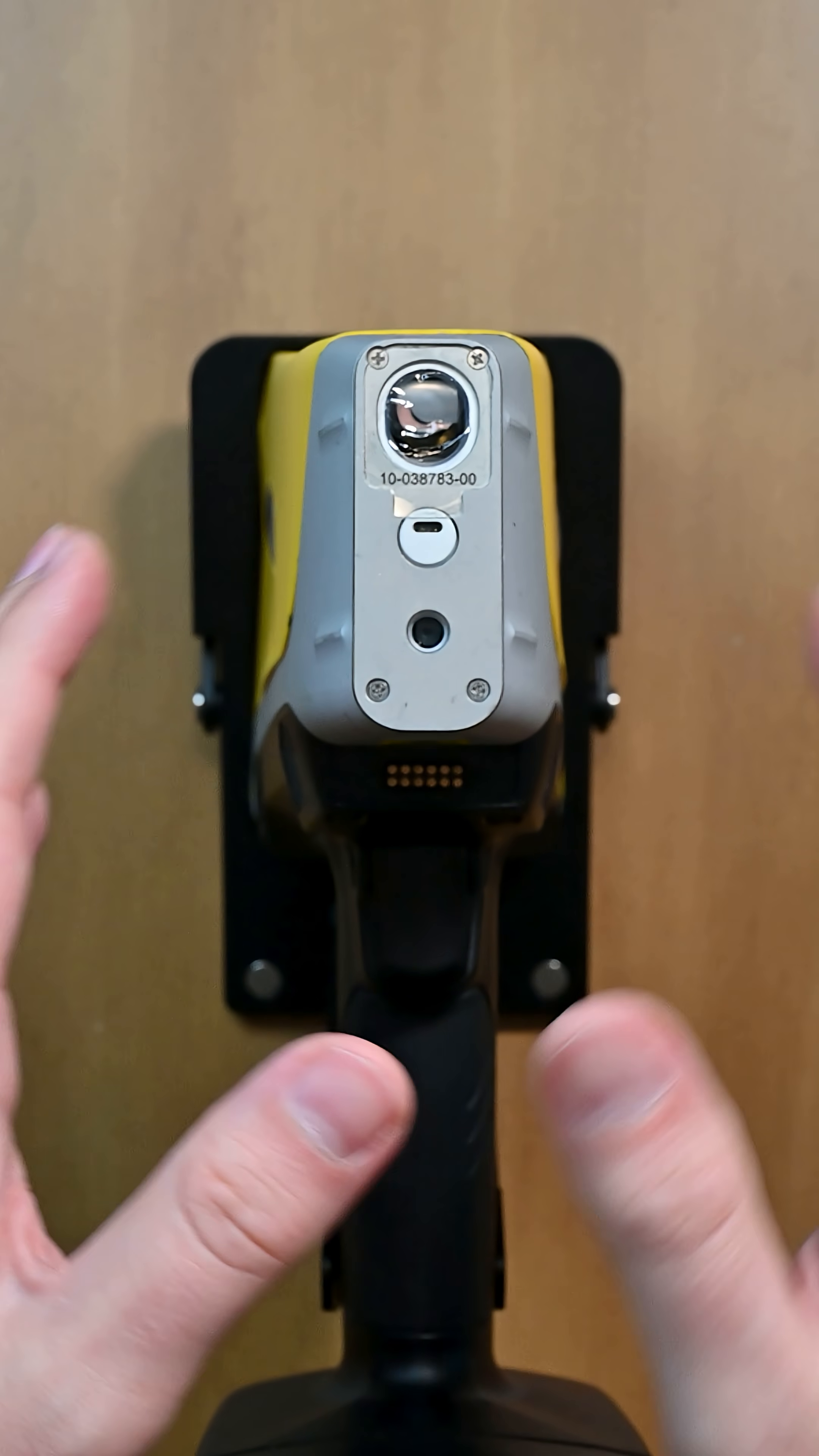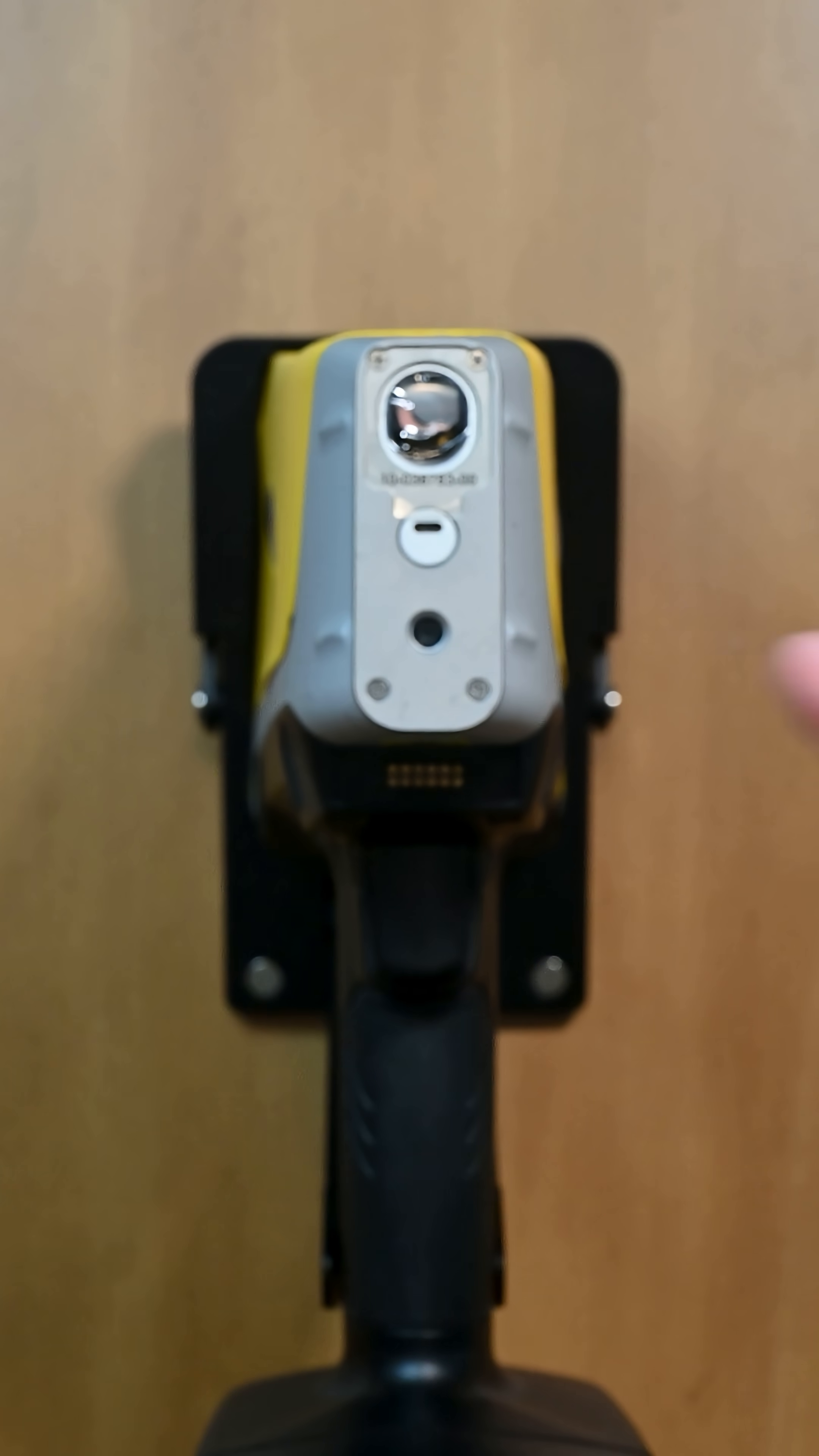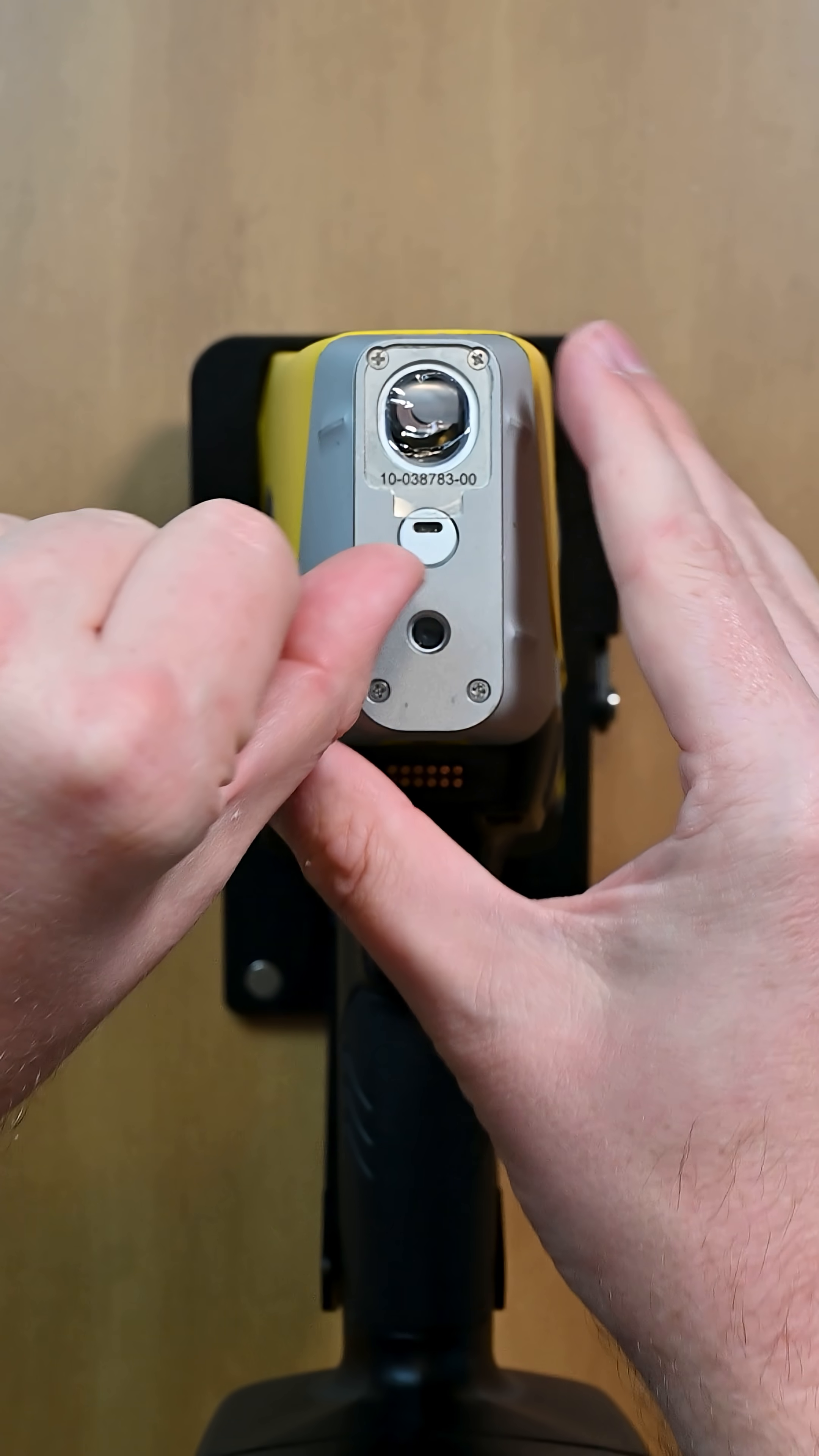Don't use any chemicals to wipe this down, just a dry wipe, but just make sure that all the dust falls away. In this case, we're very clean.